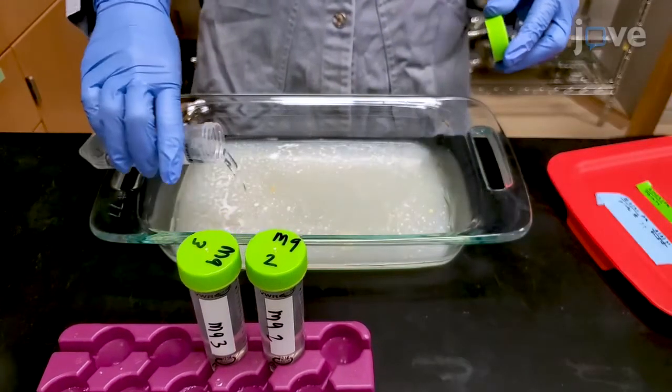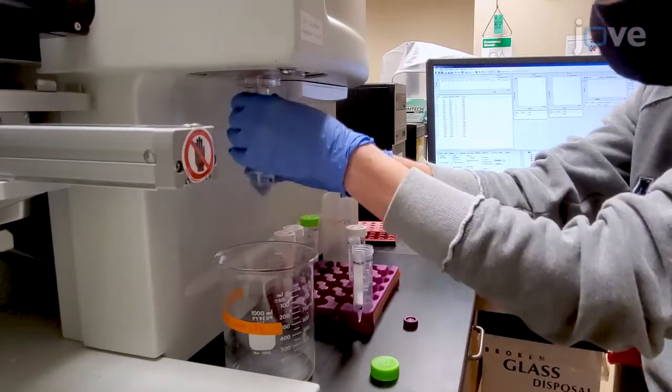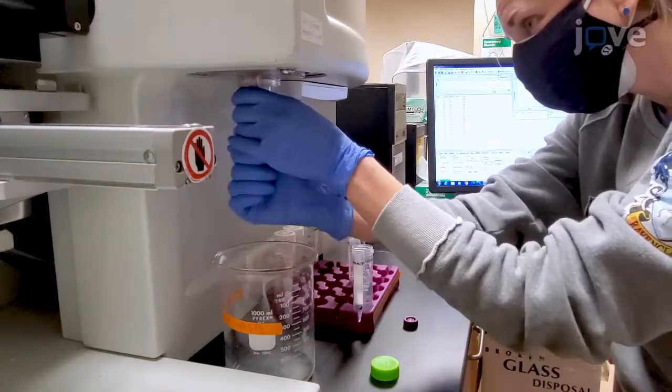This technique allows us to collect large-scale worm populations to be used for multiple omics platforms with minimal manipulation. This technique allows us to collect mixed stage C. elegans populations across multiple omics experiments to obtain a holistic picture of each sample.